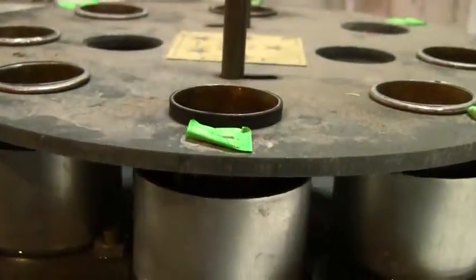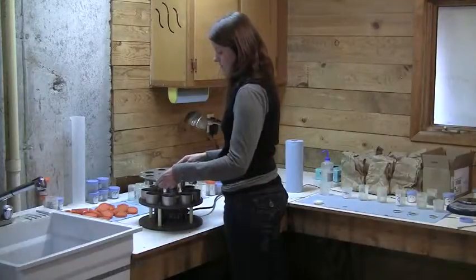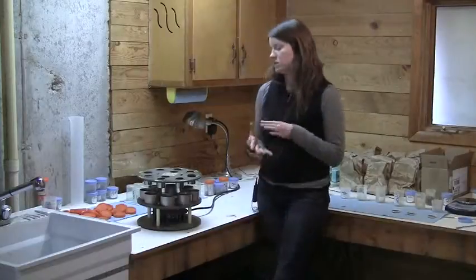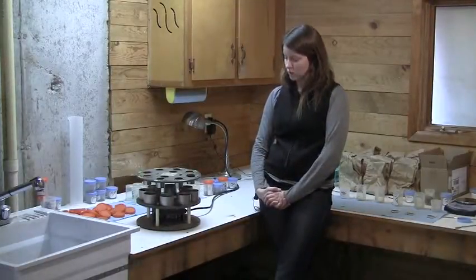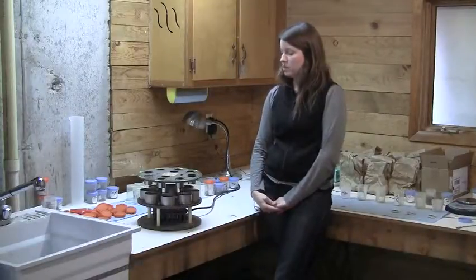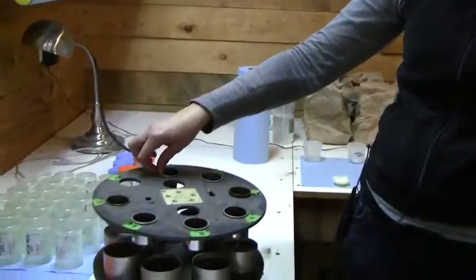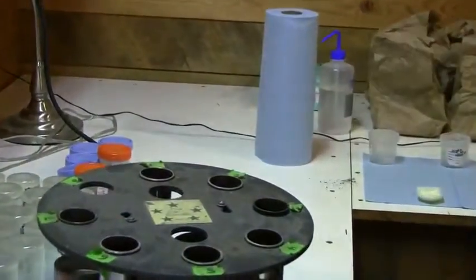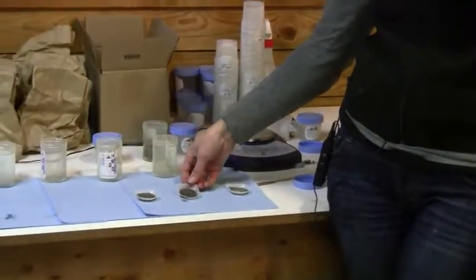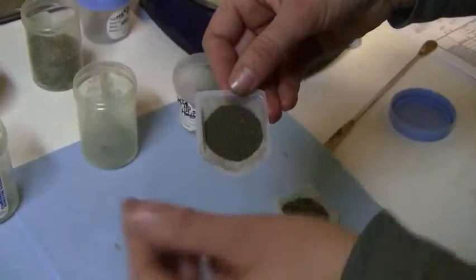After the 5 minutes is over, what we have in the sieve after the water drains out is any stable aggregates that are still bound together and any coarse material like sand and other organic materials. We take this sample and dry it in the oven, and after about 2 days we'll have the stable aggregates plus coarse materials.